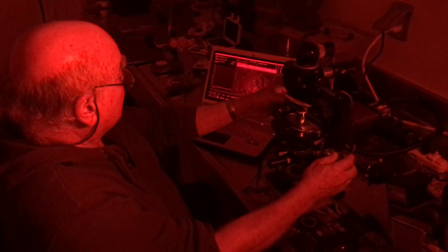Now I'm going to go back to my screen and move the preparation so that one of those outer segments is laying over the beam — let's pick that one right there. The beam is now passing through this cell right here. So now the question is: as I scan, what wavelengths are being absorbed by that cell?